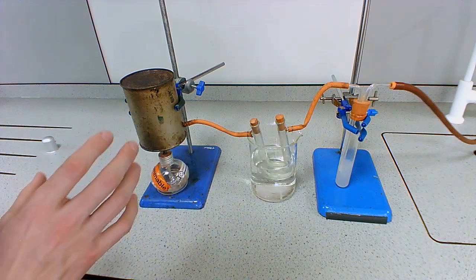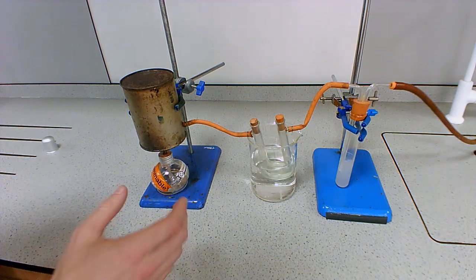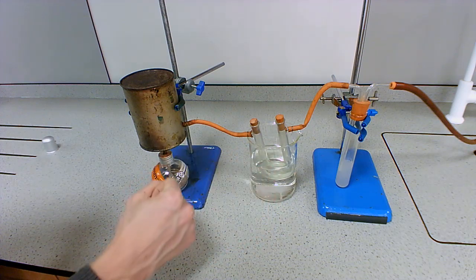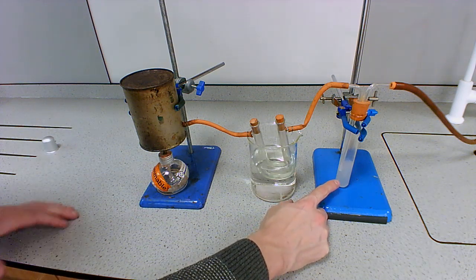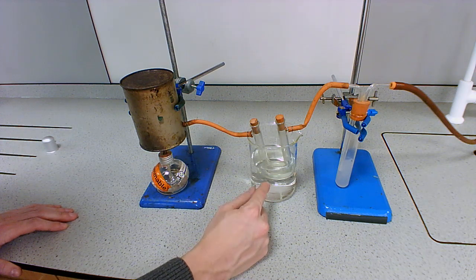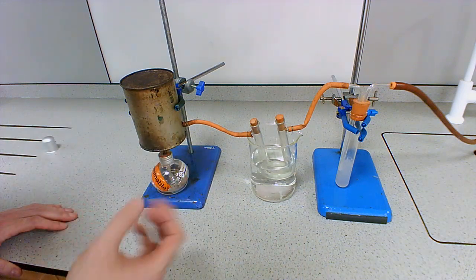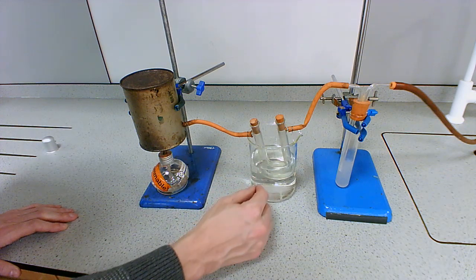Now I'm not going to leave this running for the whole experiment because there's no need. But if we leave this running, what we will start to see is condensation in this tube here, and that powder will turn pink. We can already see that this has turned cloudy. So we've already proven carbon dioxide, and if we left it long enough, then this would turn pink. If this had been a normal lesson, I would have set this up at the beginning and left it until the end, and we would have been able to compare before and after. But this will eventually turn pink from the water that's being produced.